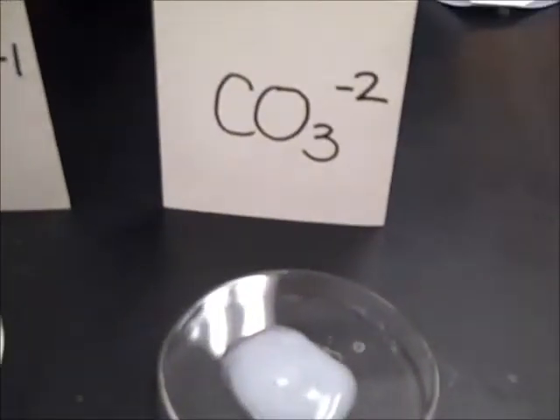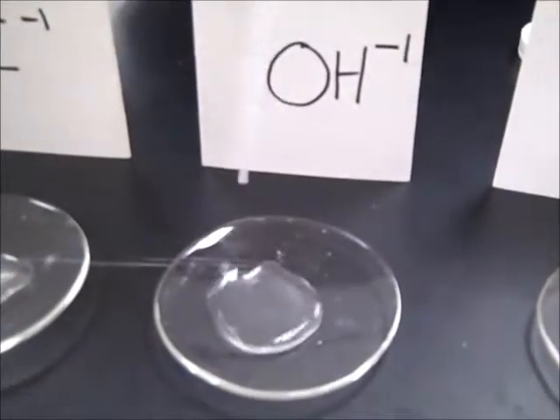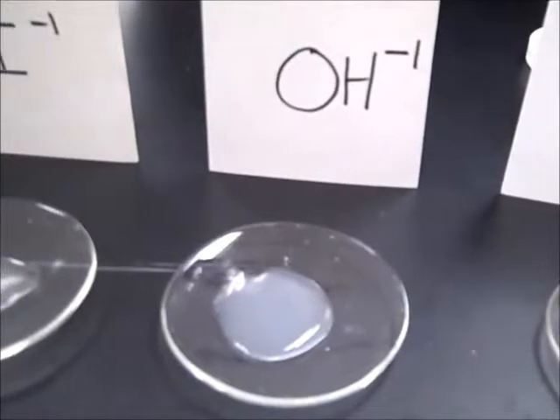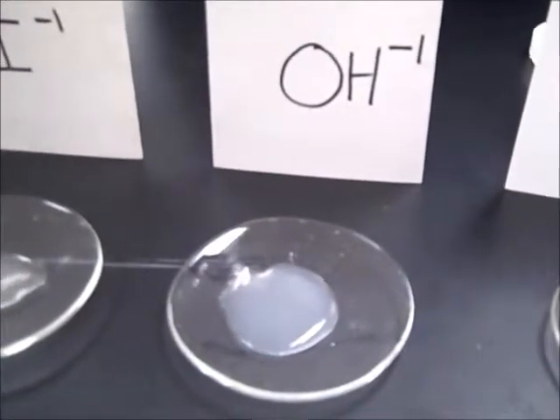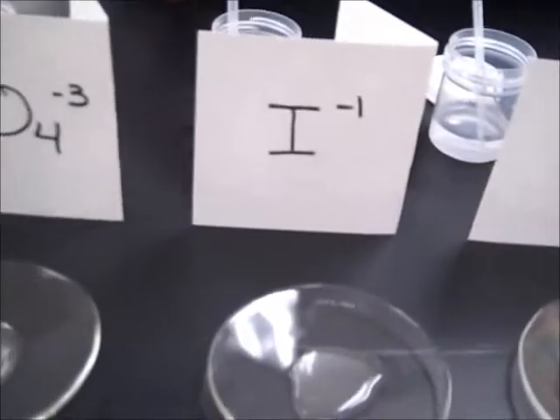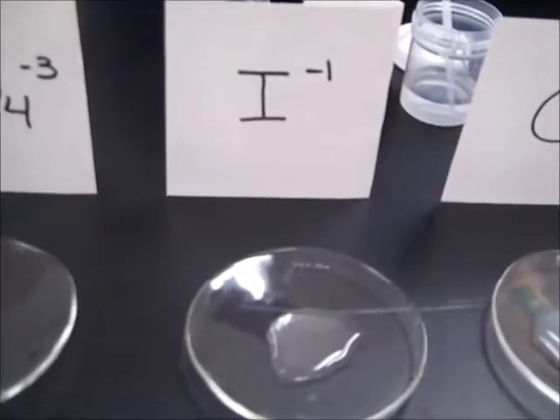See something grainy as well. This is strontium and the OH ion. Ta-da! It'll happen. All right, so it's not as exciting, but it is cloudy. This is the strontium and the iodide, I minus.